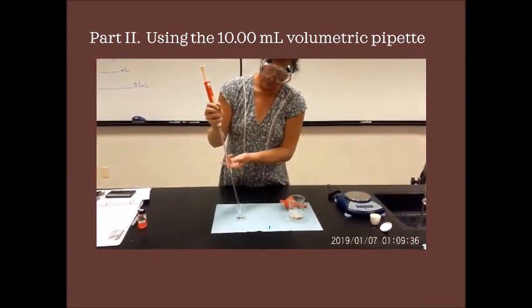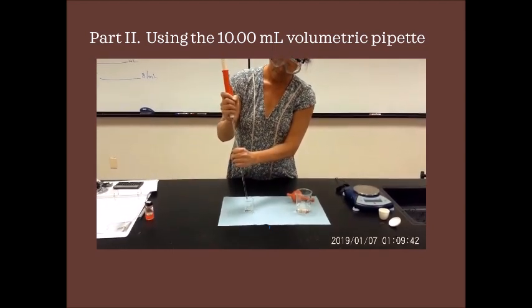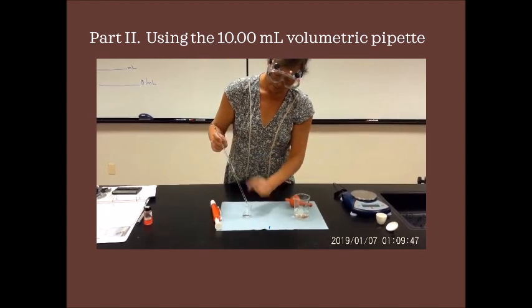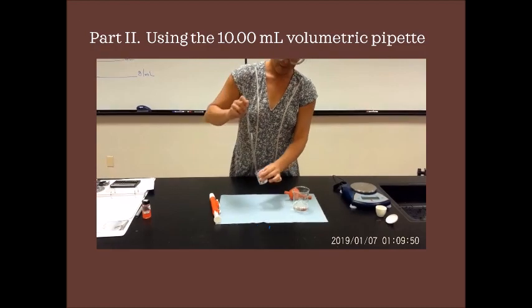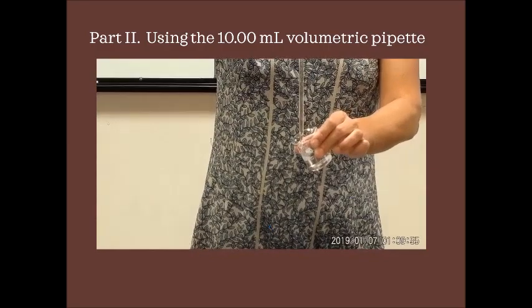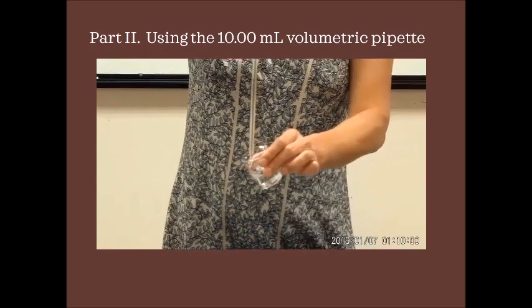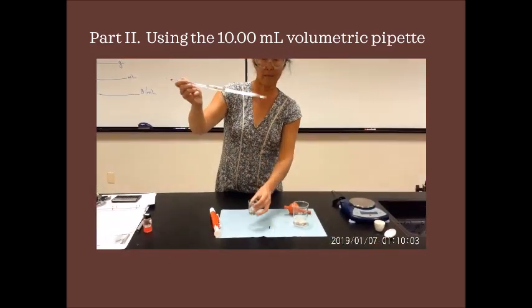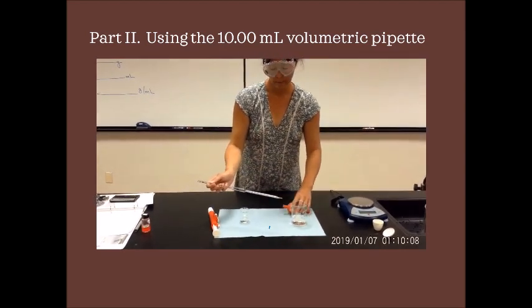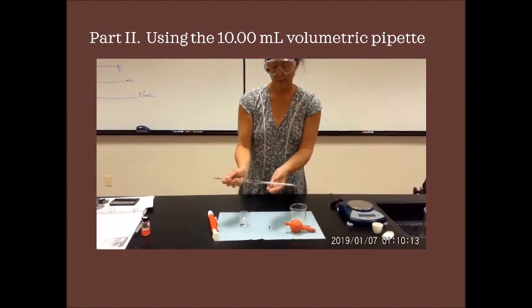Now when you transfer it, how do you get it to go? All you have to do is loosen the pipette pen off the top. And again, you can see just by gravity, the pressure pushes your solution out. So that's how you use a pipette pen. Either system will work. You'll have one drop of solution at the tip, but you've transferred exactly 10.00 milliliters of solution using a glass pipette.